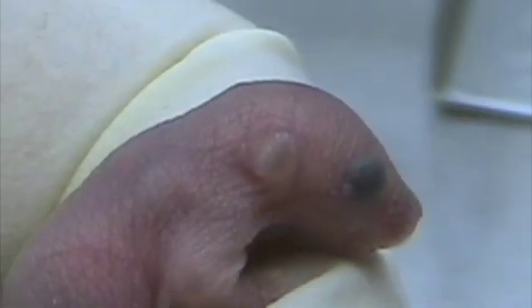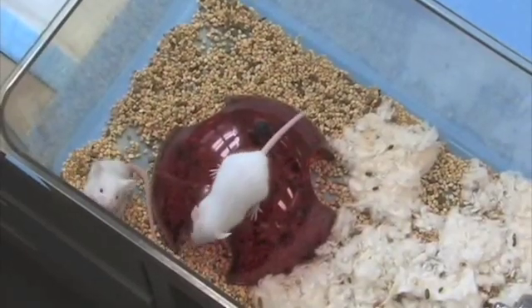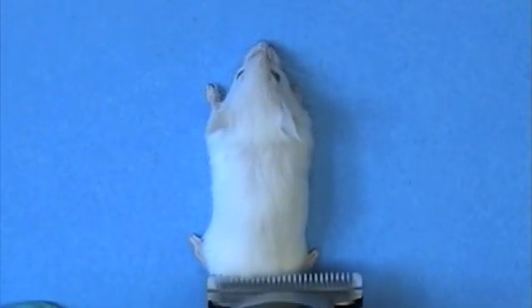When using neonatal mice, there's no need to shave the back skin. However, when you have older mice that have fur, you need to shave the back skin away so that it doesn't get in the way of cutting the sections.